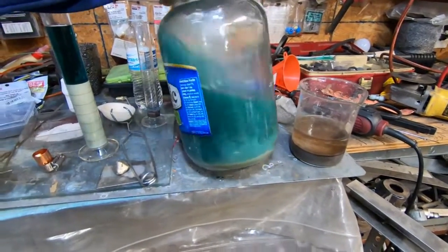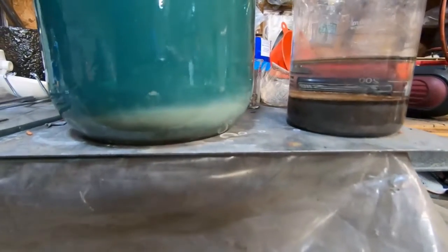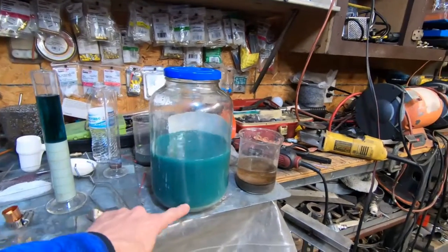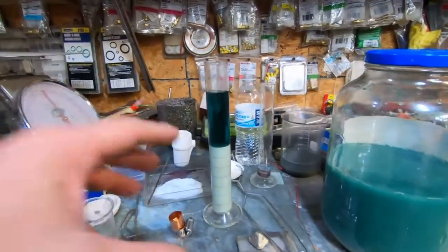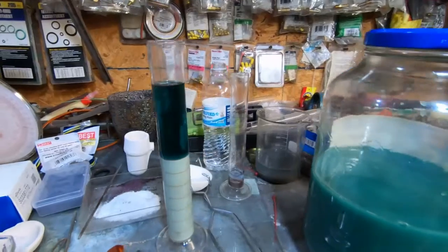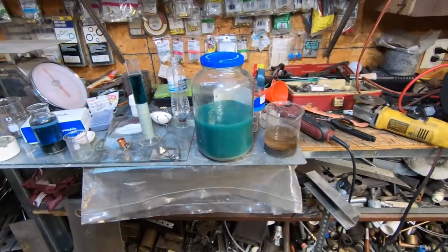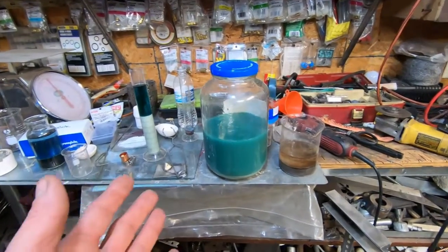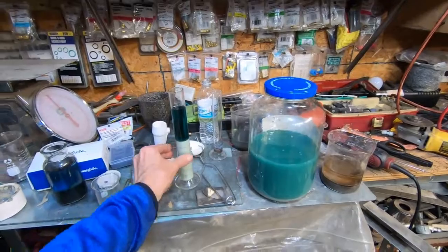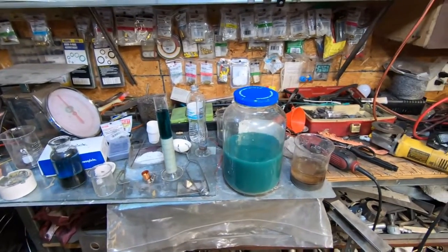Let me shake this up a little bit and show you what I'm talking about. You can see the different colors of the solution — essentially, after shaking, if you instantly dump this top layer off, it does make a different substance. When I first put this in the graduated cylinder it all looked the same, and it has slowly just sunk down. You really need a filter press for stuff like this. That pretty much is where we are in this phase of the electrowinning process. What we're going to do is separate the white stuff from the green stuff, keep this green liquid, and attempt to electrowin the nickel out of that material by using a small beaker bath with nickel electrodes.